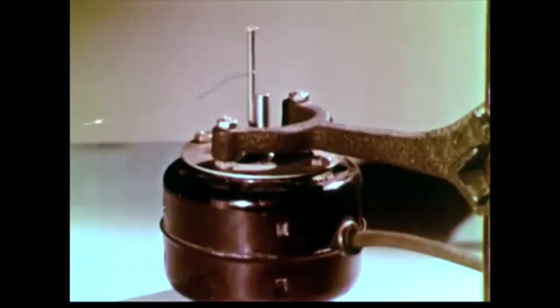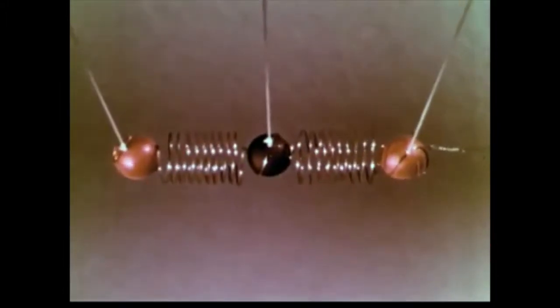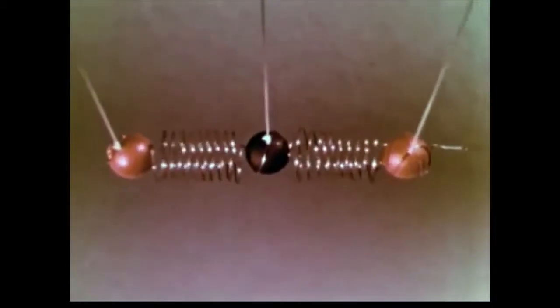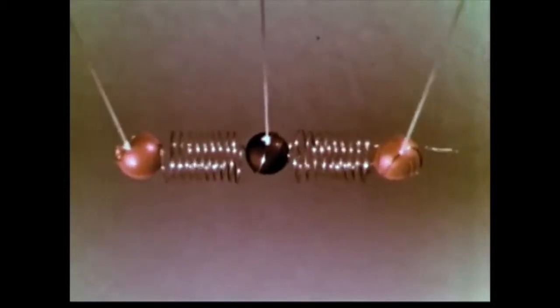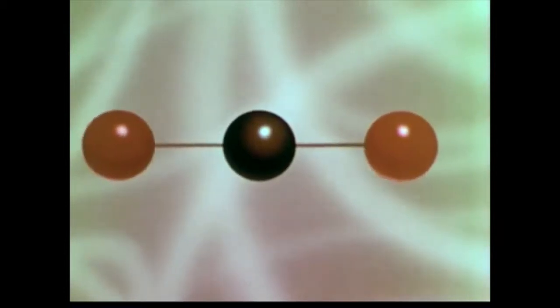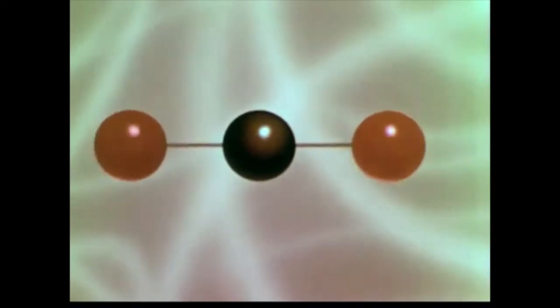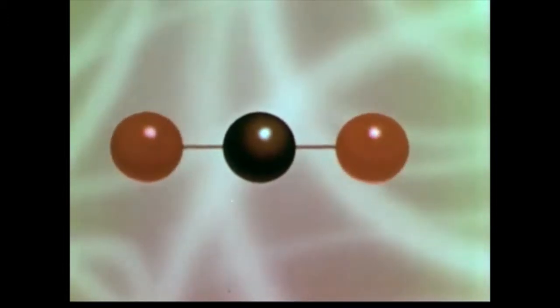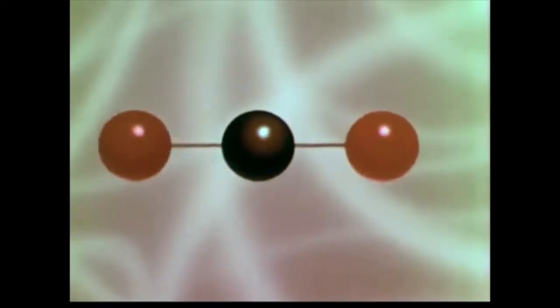As we increase speed, we reach another normal frequency where the atoms begin again to execute a smooth, characteristic vibrational pattern. We note that at this frequency, the molecule has its atoms moving along the line of the bonds in a nice symmetrical fashion, with the two oxygen atoms breathing in and out and the carbon atom staying fairly still. By increasing the frequency again, we get away from synchronization, and the molecule again shows only chaotic motion.